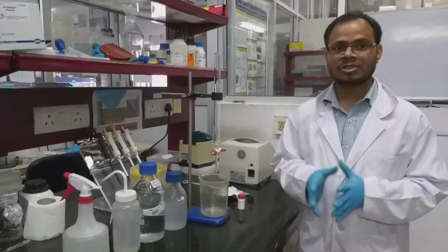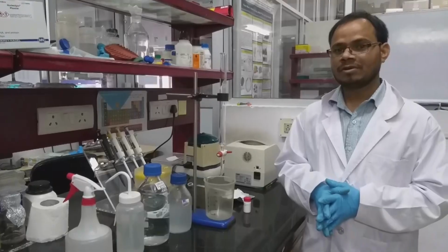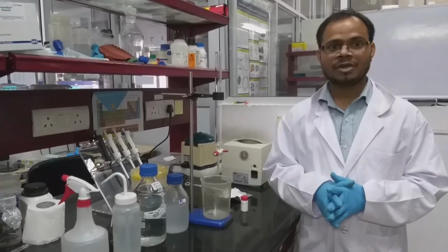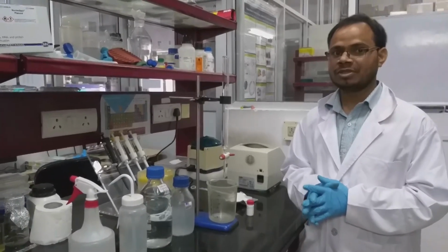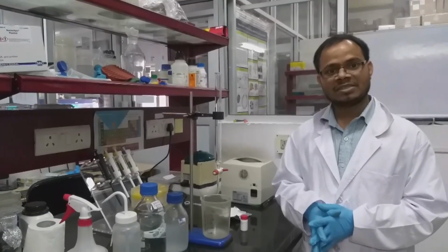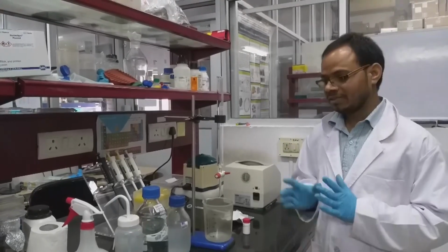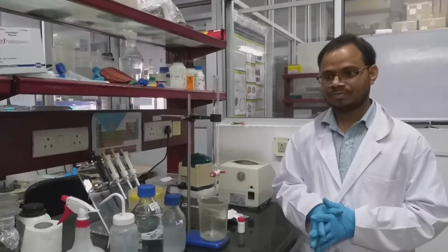In this video, we will demonstrate how to perform gel filtration chromatography or size exclusion chromatography. There are various methods available in chromatography to separate different types of biomolecules. For example, if you want to separate based on size or shape, it is called gel filtration chromatography, which suits the most. If you want to separate molecules based on their charge, then you can go for ion exchange chromatography. In this video we are mainly focusing on gel filtration or size exclusion chromatography.